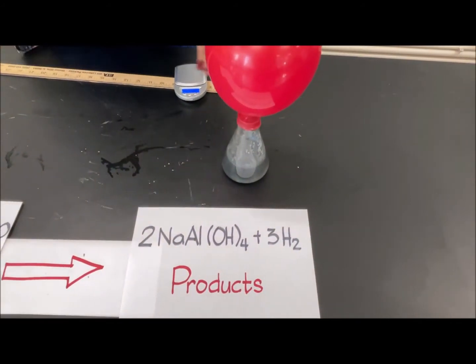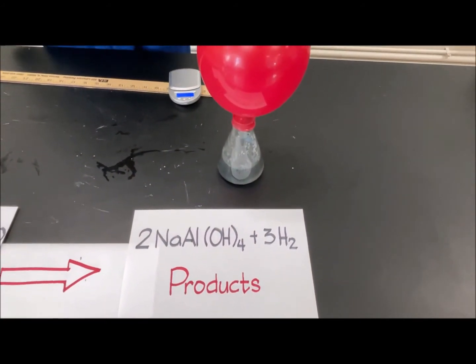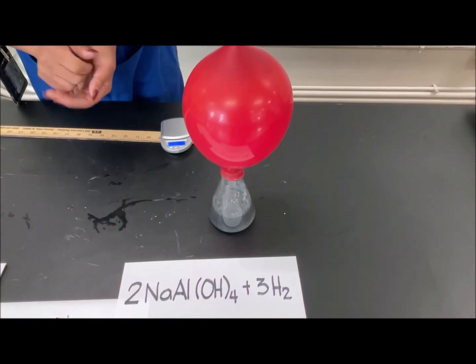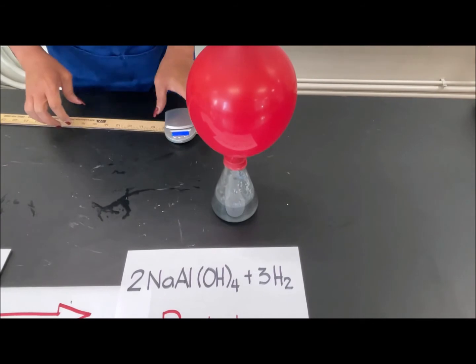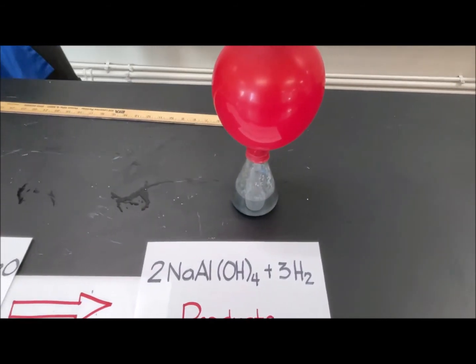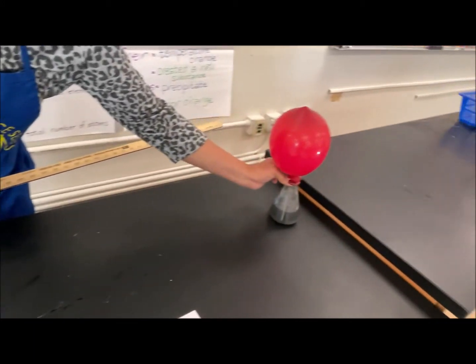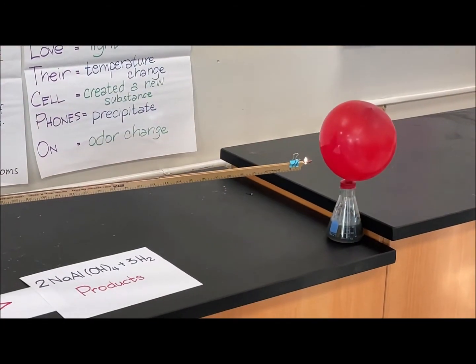So we're going to test the flammability here. This is a hydrogen balloon, and so therefore it should be flammable. So we're going to test that. Okay, let's put it over there. The flammability, if this is really hydrogen.